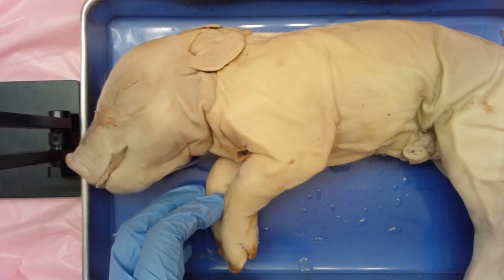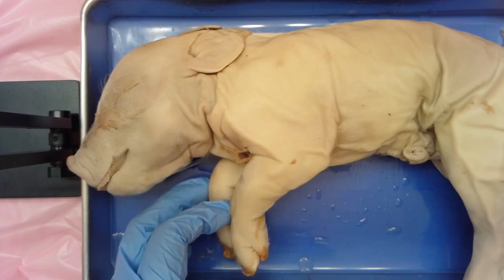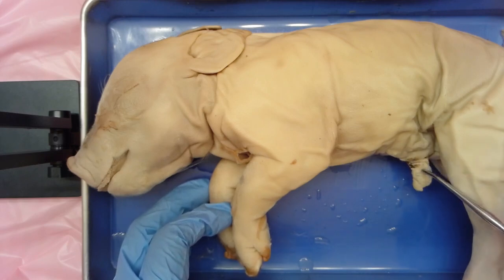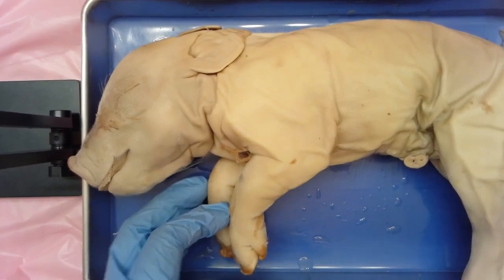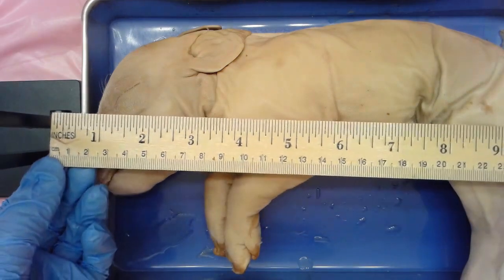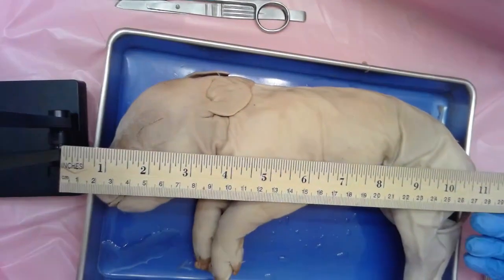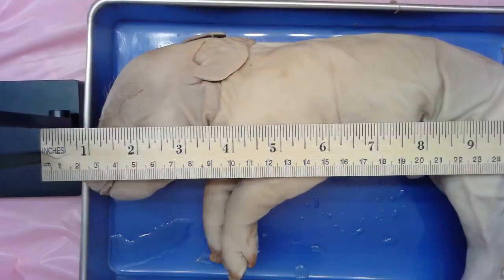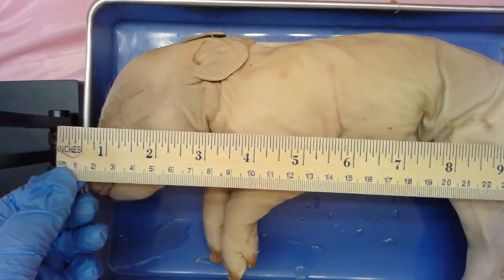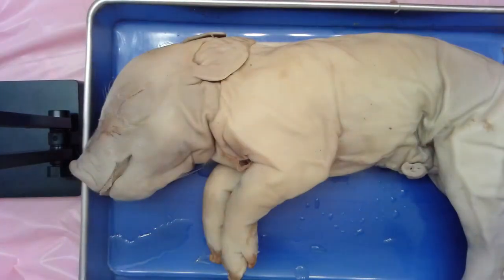We want to first look at approximately how old this fetus is. The term fetus means this pig wasn't born yet — you can tell because there is an umbilical cord still visible. We look at the length of the pig to give us an idea of approximately how old it might have been. Looking at this ruler, we can see it is approximately 30 centimeters, which according to the chart on the handout means this is about full term — approximately 112 to 115 days — giving us an idea of how far along in the gestation period we are talking about.